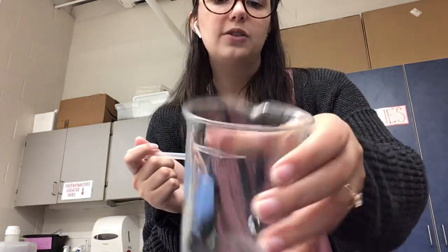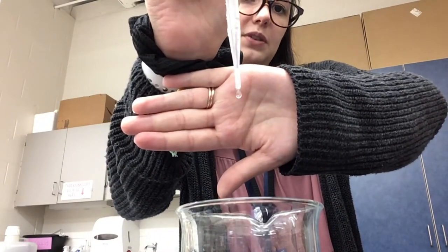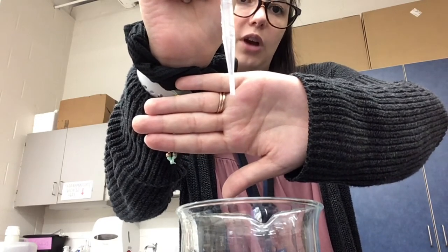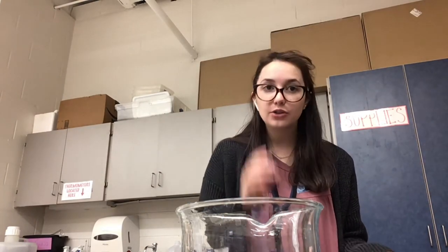First off, it's a drop of water, so my beaker really wouldn't catch it fast enough — and look at how quickly that drops. What's the volume of this drop of water? It's difficult to come up with the volume. However, in the lab, I know I can measure the mass of one drop of water using a mass balance, and I also know the density of water. Using that, I can use the density equation.